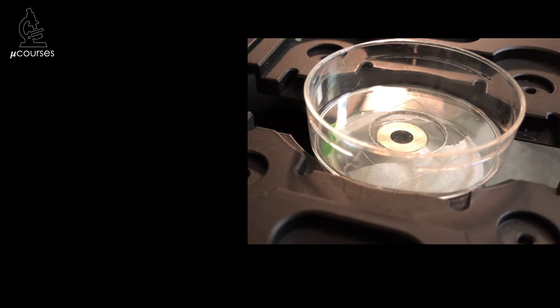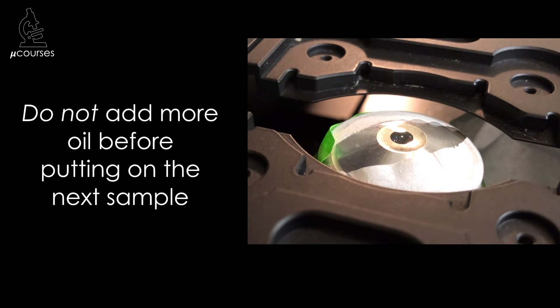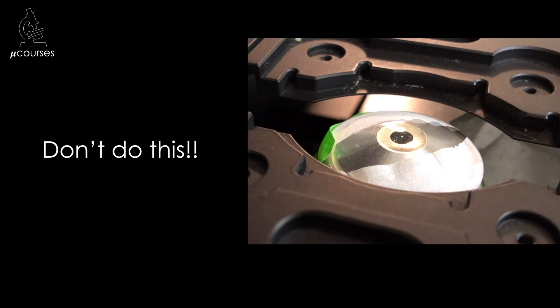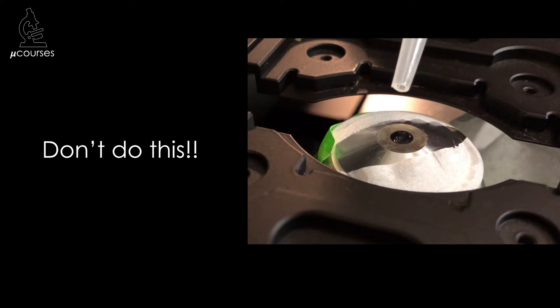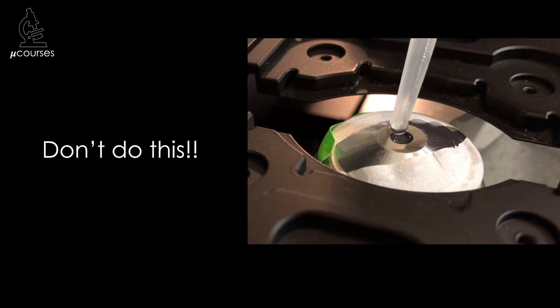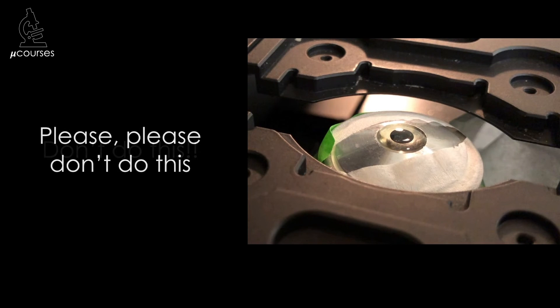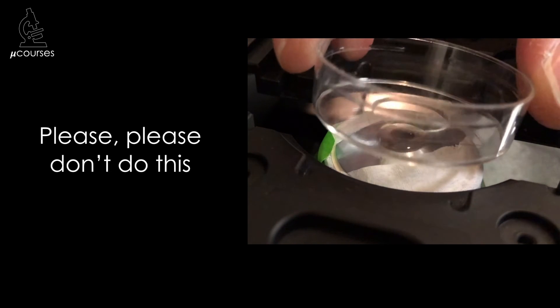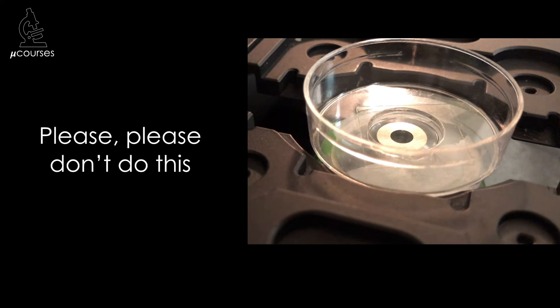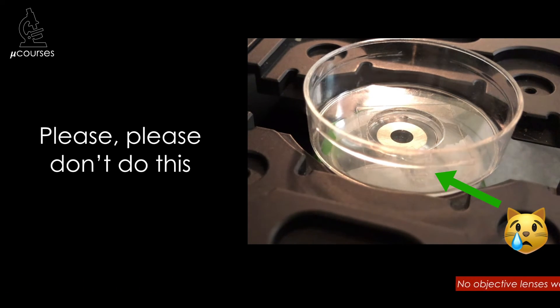So now you've finished with that dish and you want to put a new dish on — this is where you have to be really careful. You do not want to add more oil before you put on the next sample, because there is plenty of immersion oil left on that lens. If you do add more oil, there's going to be too much sitting on the lens. You might see the oil drip immediately down the sides so you know right away that you've done something wrong, but it also might just sit on top of the objective lens. Then once you add a sample and begin moving it around and changing focus, the immersion oil can drip down the side and get into the area between the inner and outer barrel.